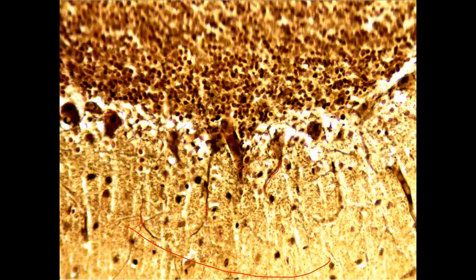These are the fibers of the Purkinje cells which are coming into the molecular layer. This is the molecular layer. This would be the basket cells, and these are the Purkinje cells right here, flask shaped, and this entire thing is basically the granular layer. So these are the granular cells. I don't think I can see a basket cell here, but it will probably be somewhere around. Maybe this is a basket cell that's inhibiting the fiber of the Purkinje cell.